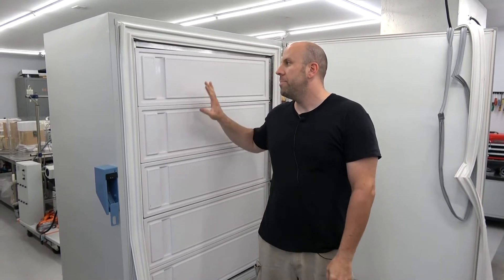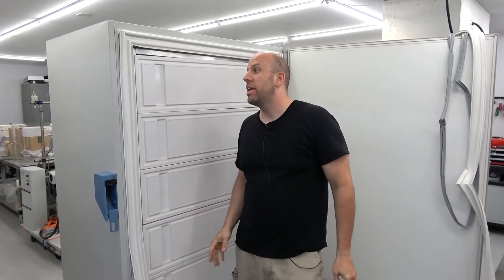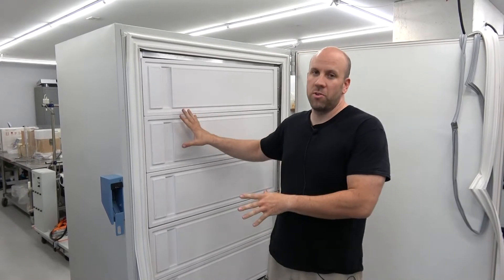Hi, my name is Joe. I'm a technician here at New Life Scientific. I was changing an ultra-low temperature freezer door seal and I was in the middle of it and I thought this might be a good thing to record for you guys to see in case you want to do it yourself. There's really no need to call a refrigeration technician. It's something you can do on your own — it's pretty simple, especially for a Thermo.